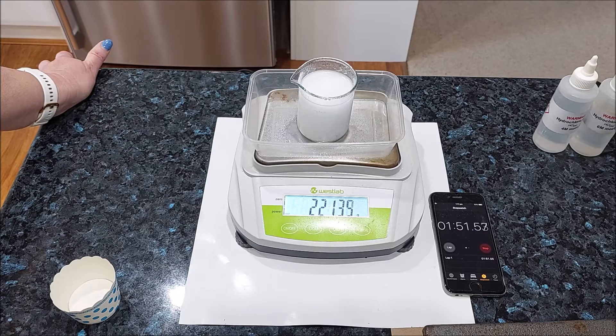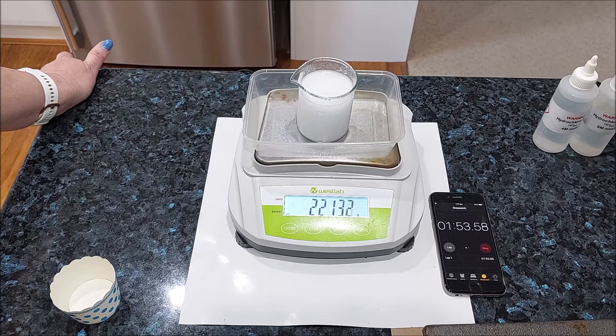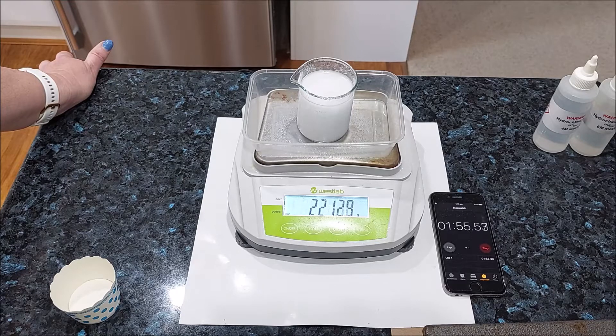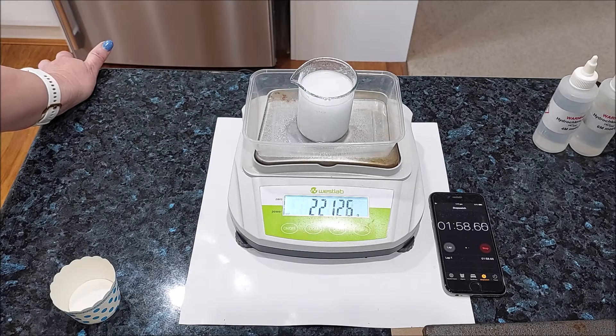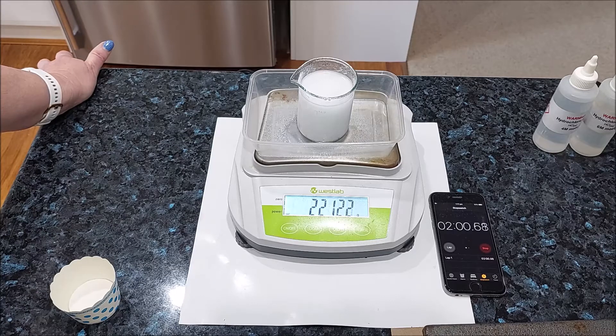Get ready to record that 2 minute mark mass. 3, 2, 1 — read it.